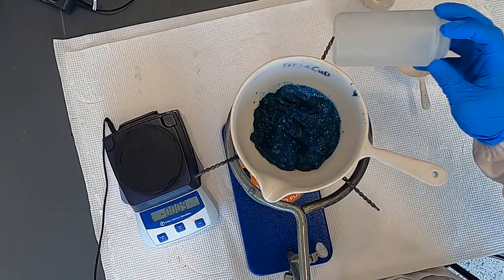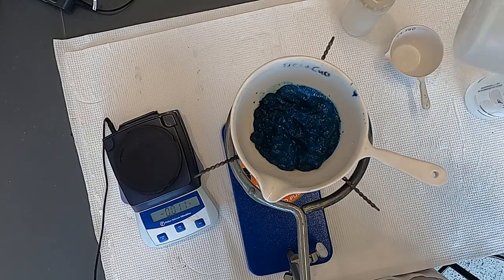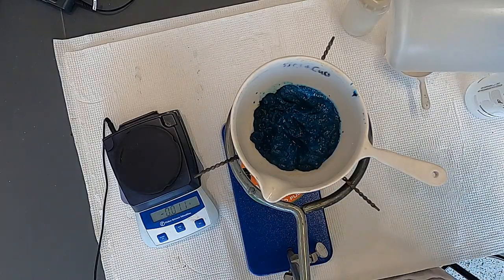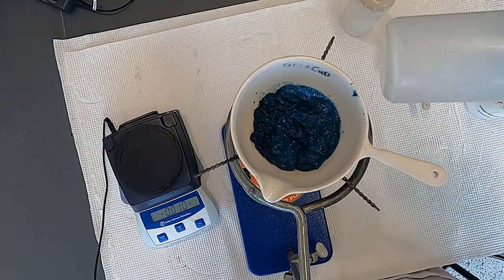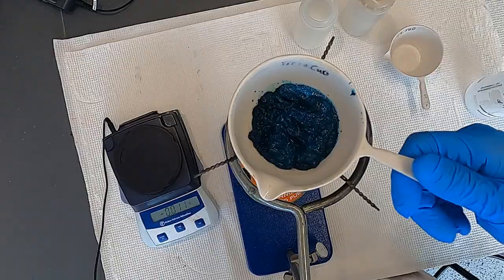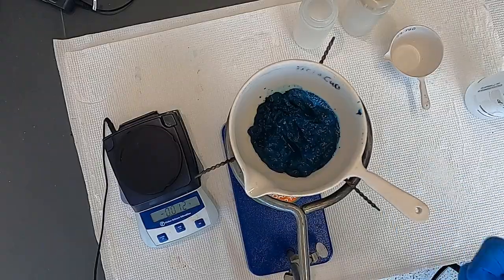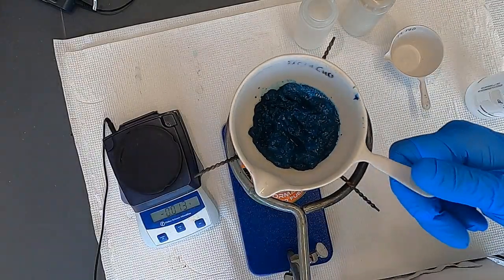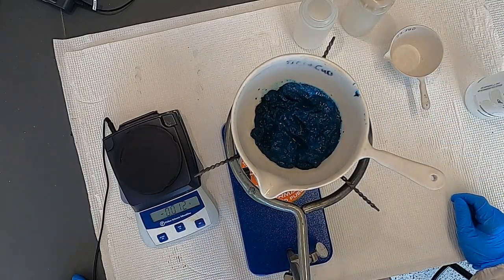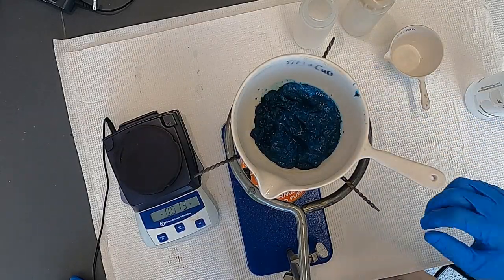One good question is, if I did not do that, would the numbers work out all right? In other words, something else existed in that aqueous layer before. And so that's something to think about as far as a source of error. However, I rinsed it thoroughly and then removed as much of the liquid as I could. So primarily what I have here is copper hydroxide. It's a little wet, but most of the aqueous portion that existed before is gone.